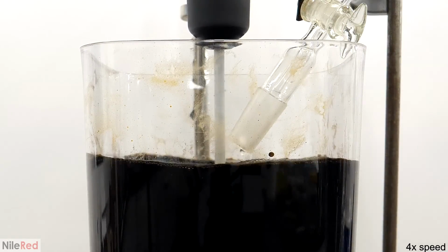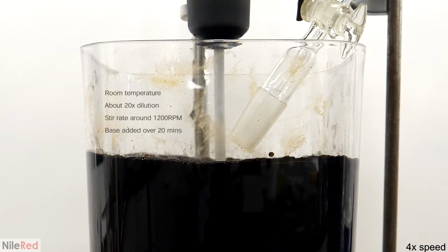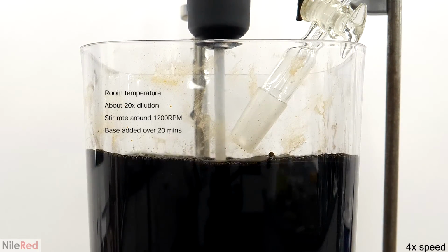On top of this, there were other variables, like how much extra water I had to include in this reaction, and things like temperature, and I had to find a balance between all these factors. It's definitely still far from perfect, but what I found worked was to do it at room temperature, with about a 20 times dilution, a stir rate of about 1200 like I said before, and to add the base over the course of 20 minutes.